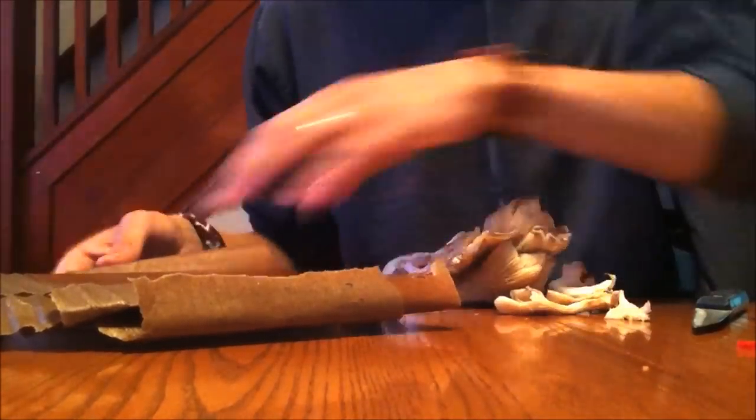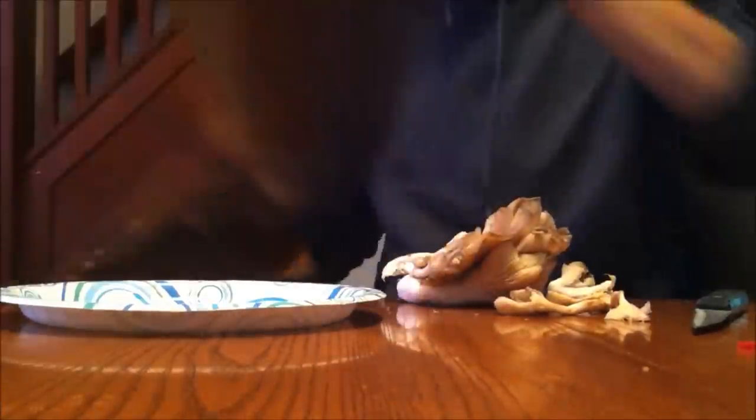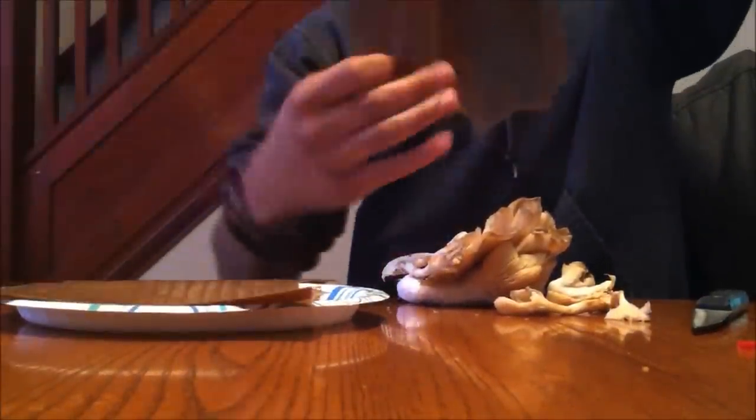So, alright, what we're doing, we have our cardboard here. We separated the pieces, the corrugated pieces, so we just have individual strips.